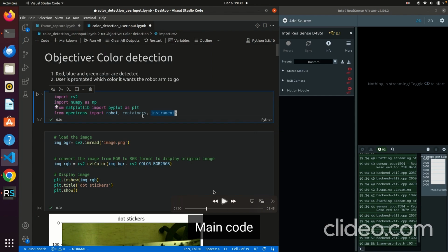And here in the color detection code, I'm going to import the CV2 library and NumPy, and matplotlib for graphing the simulation of the robot, where it's at in the coordinate system. And this is the Opentrons API to control the robot arm. Same, you will load the image that we captured from the frame capture code, and then you convert the image from BGR to RGB to show it in the cell right here.